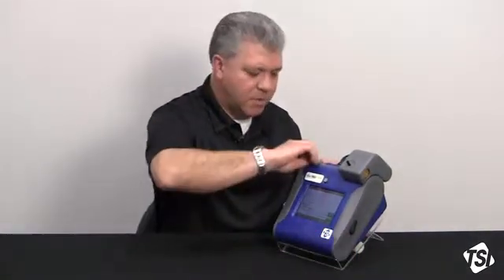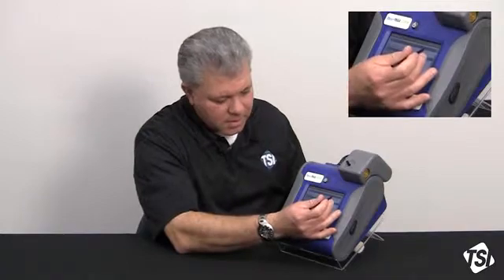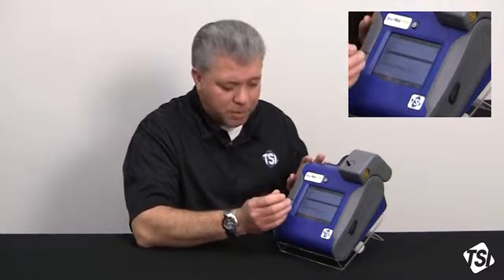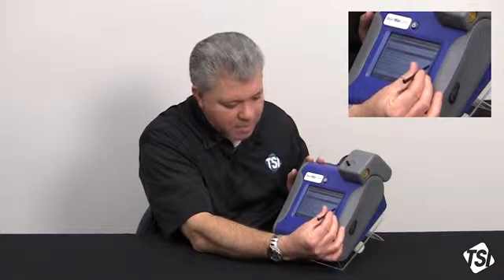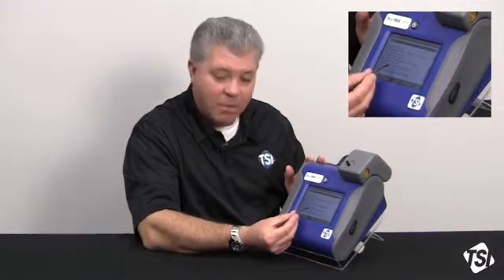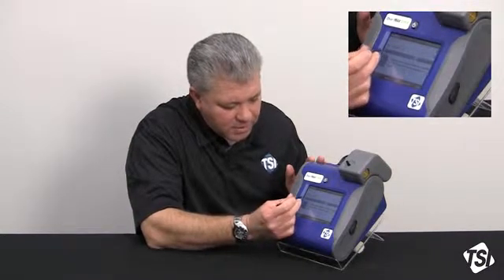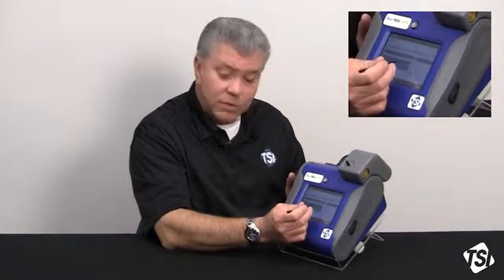Now what we do is we go over to the setup menu, or excuse me, the run mode menu. Click on that. Come up to a logged program. Now you set this through the logging programs, and it's not the manual program, only the program log modes. So I'm going to select one of the program log modes. I'm going to scroll down to the very bottom, and basically here, AutoZero module on or off. I'm going to select that, and I'm going to toggle the down arrow key to turn it on and save that. And then it's going to reset the logging interval to 2 minutes.